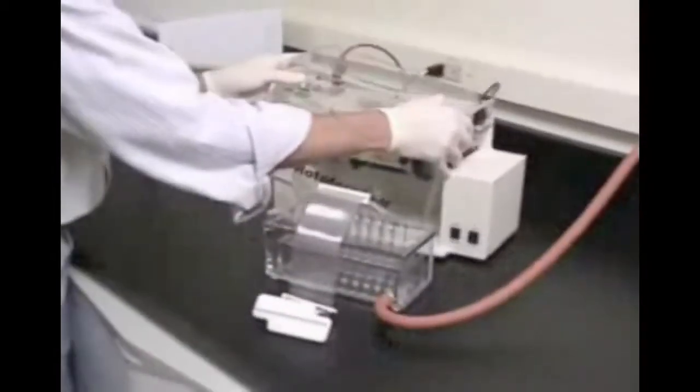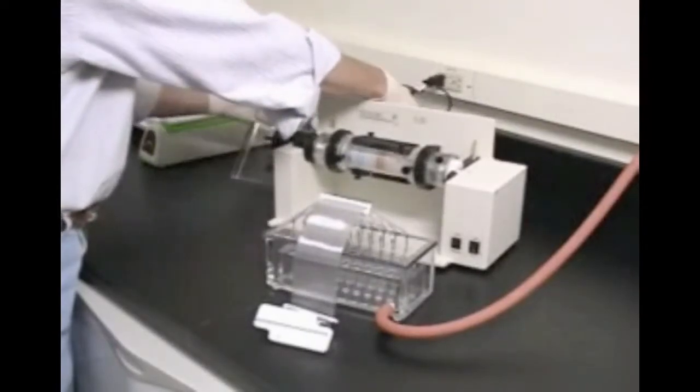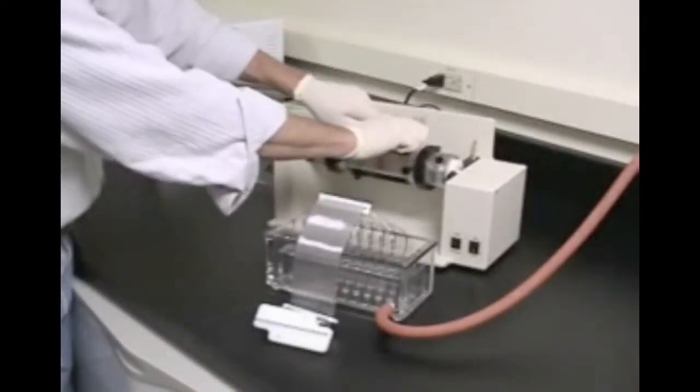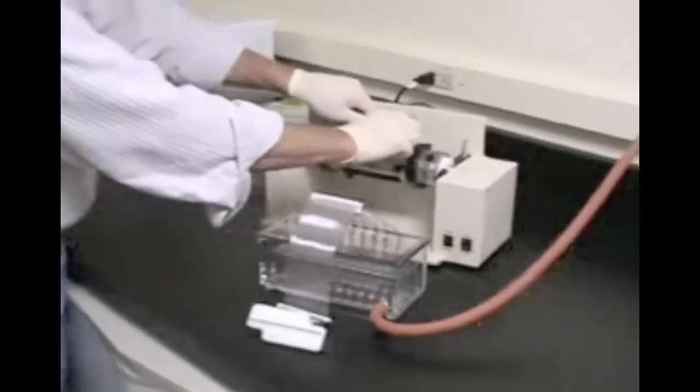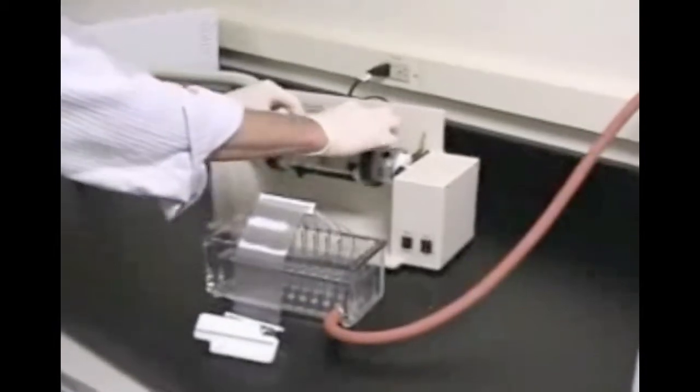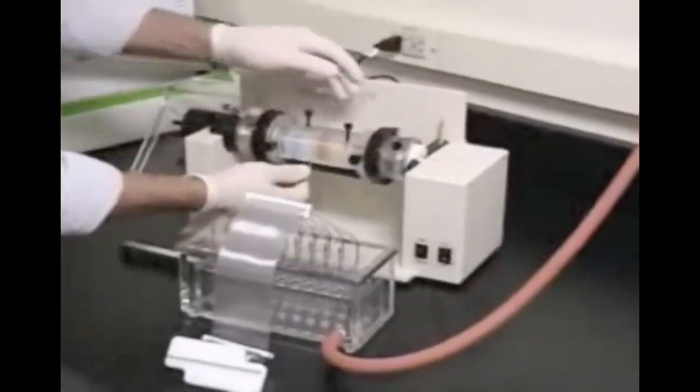Turn the power supply off, disconnect the power supply, and remove the cover of the chassis. Remove both the upper and lower focusing chamber cell cover blocks. Remember that the harvesting ports are still covered with tape.